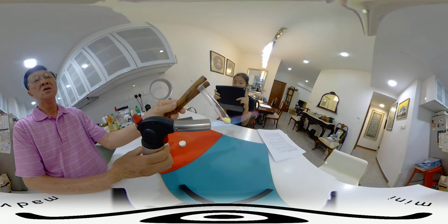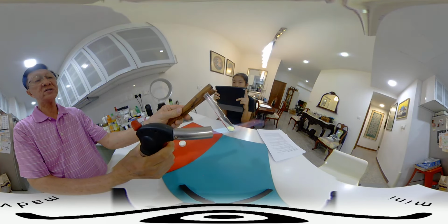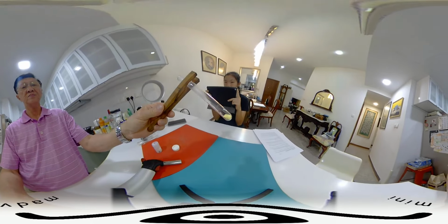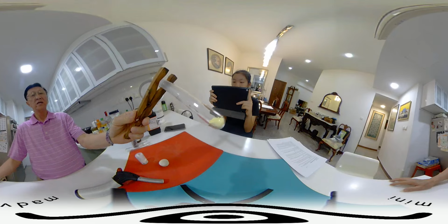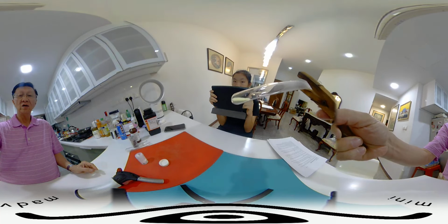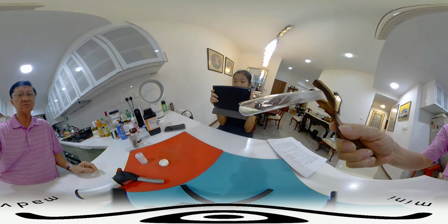Okay? So this is a change of color, but it is not a reaction. Why is it not a reaction? We shall see. Alright. We now let it cool. So we let it cool and see. And can you see when it cools? It changed back to white. Can you see it's slowly changing back to white?